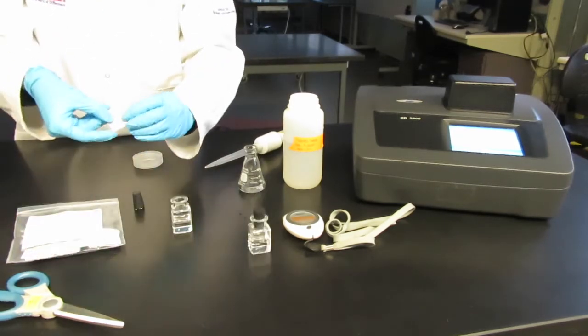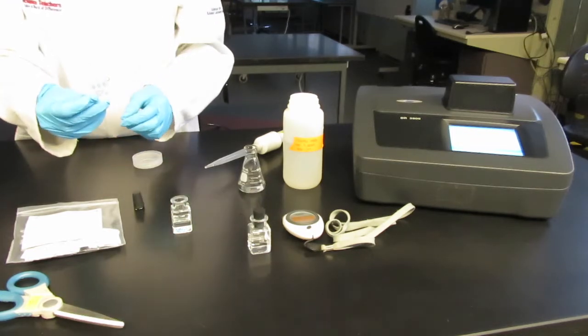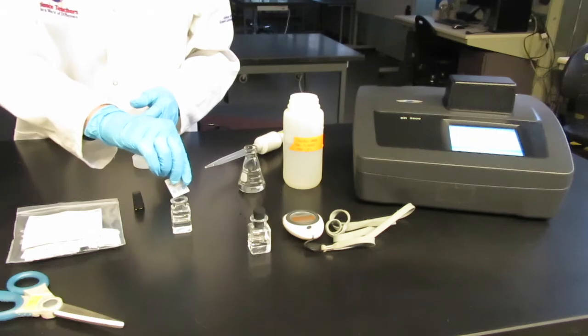Next add one phosphate powder pillow into one cuvette. This will be your sample cuvette.